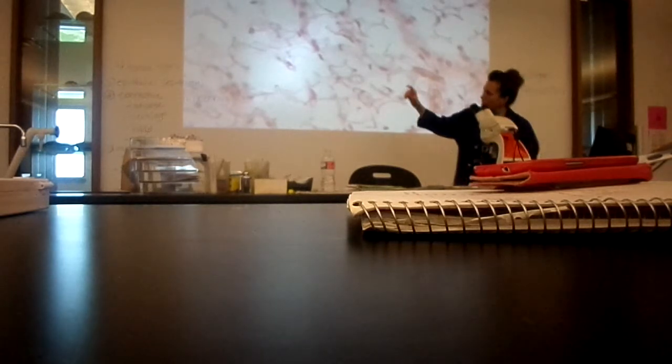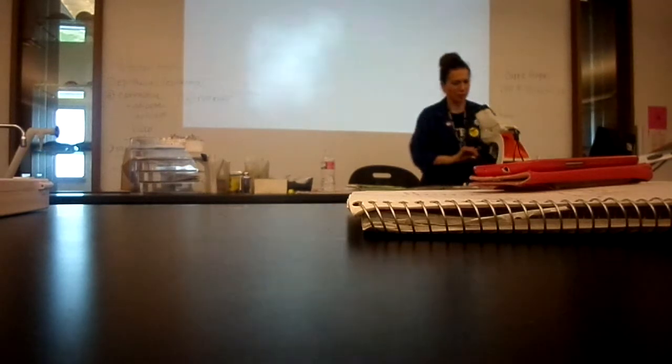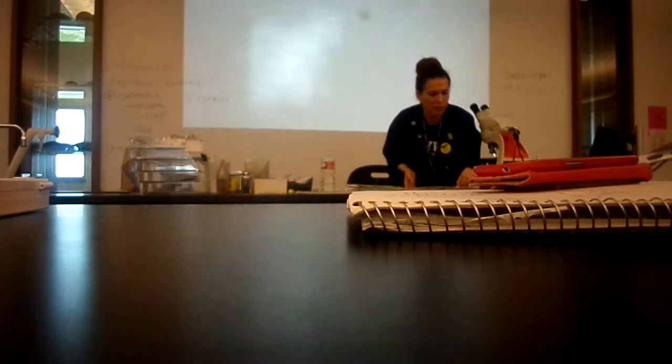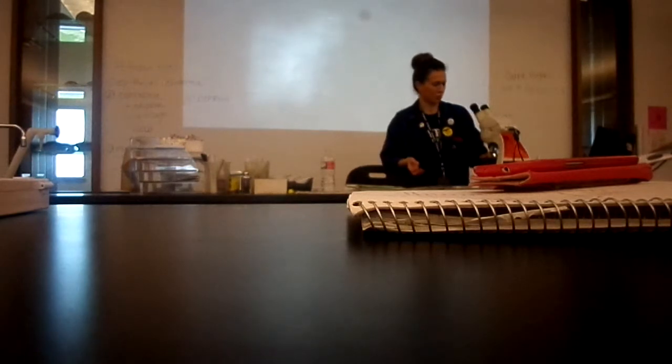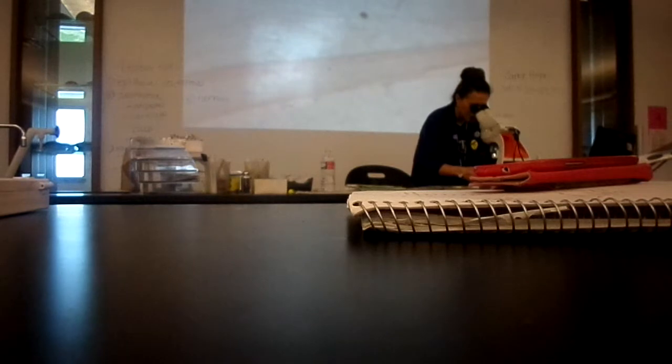We're going to look at two other types of connective tissue. The first one we're going to look at is hyaline cartilage. Hyaline cartilage is another type of connective tissue. Let me write it down.